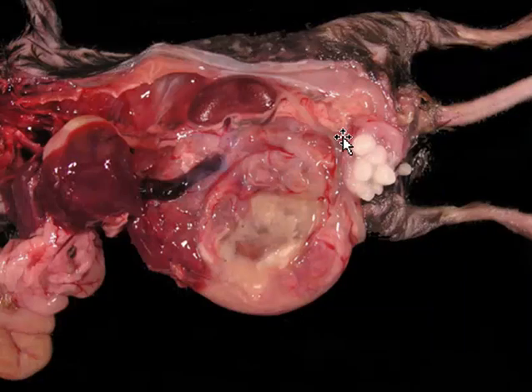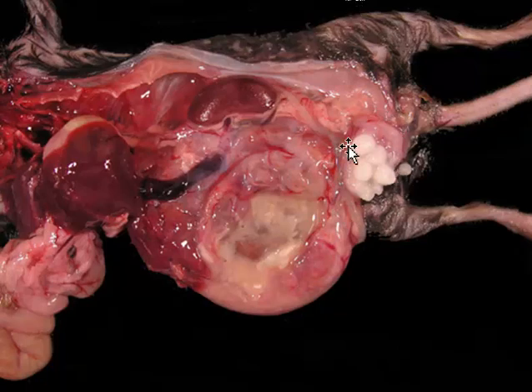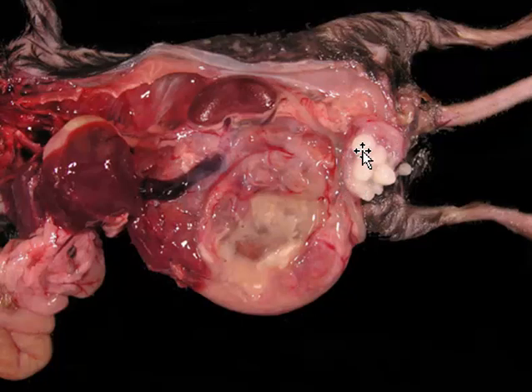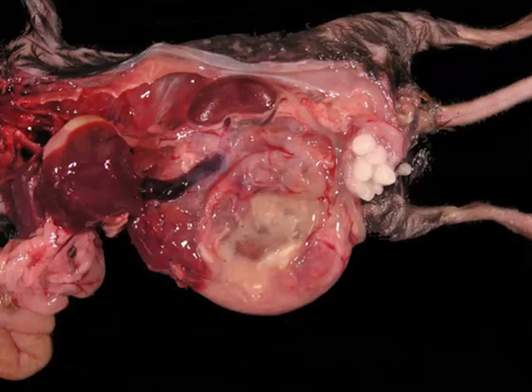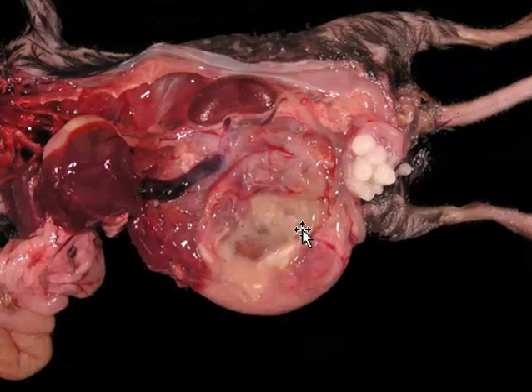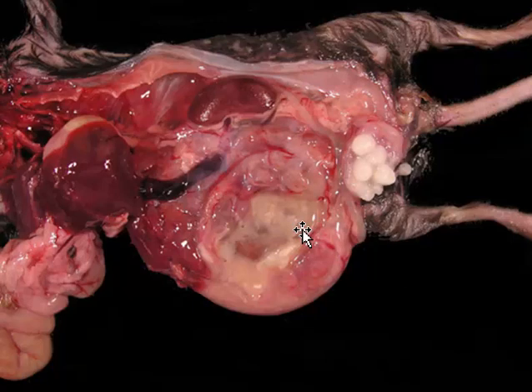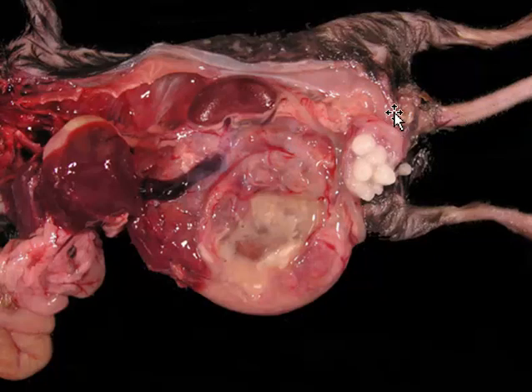When we talk about the entire syndrome, here's a mouse with not only uroliths but a bacterial infection resulting from Proteus mirabilis. Proteus mirabilis is something I've seen a number of times in rodents — I tend to ignore it in other species, but in rodents it is a pretty common cause of various forms of urinary tract infections, including some large cases of pyelonephritis as seen here. So I would pay a little more attention to Proteus mirabilis when you get it.